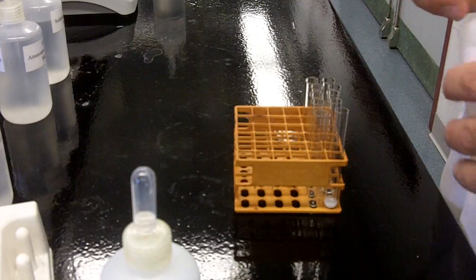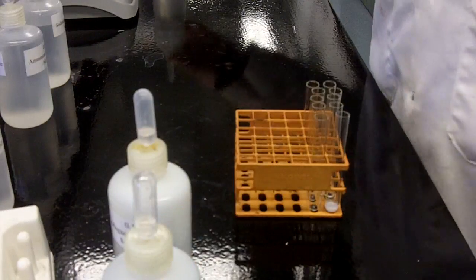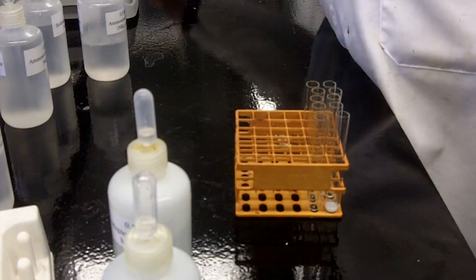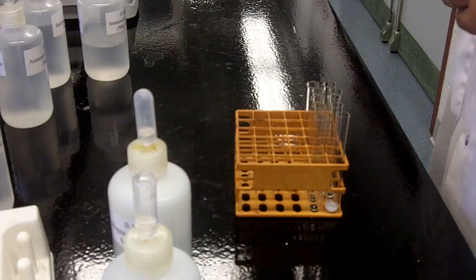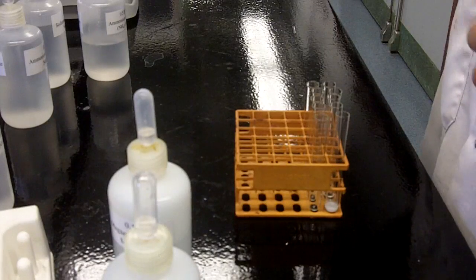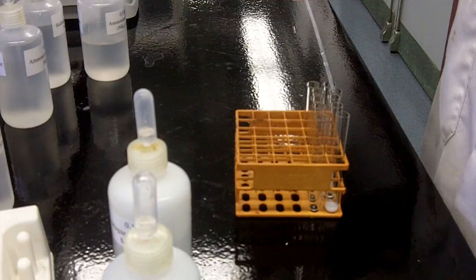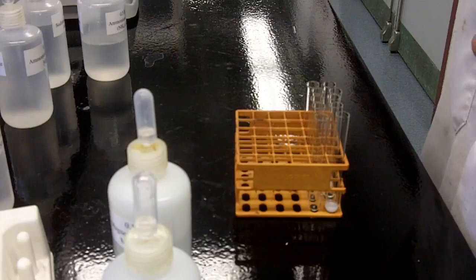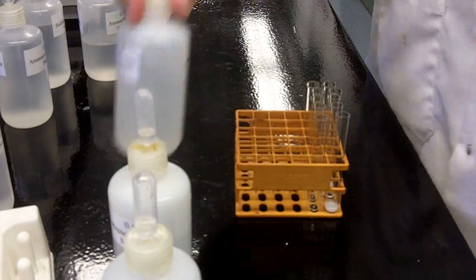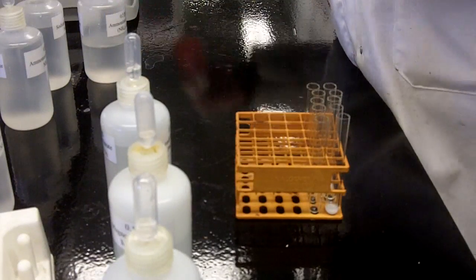In terms of mixing tubes, you don't have a huge amount of volume there, so the best way to do these is typically with a finger flick. As I'm demonstrating there, just do that.